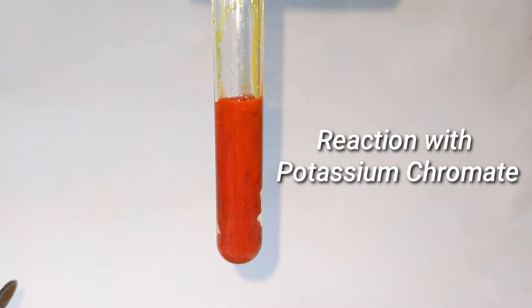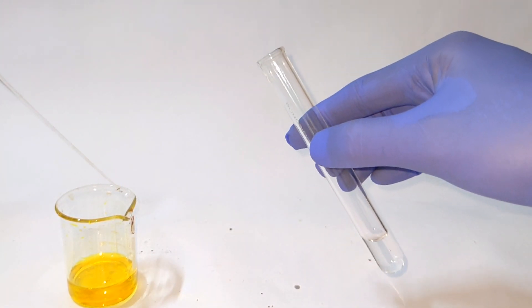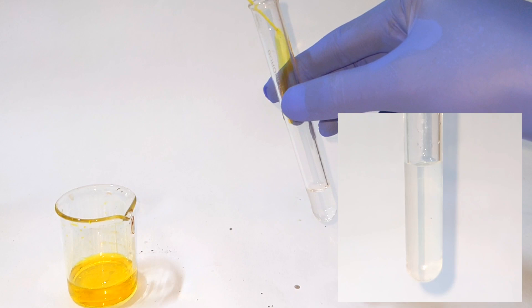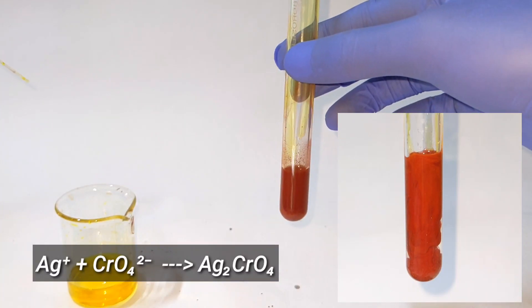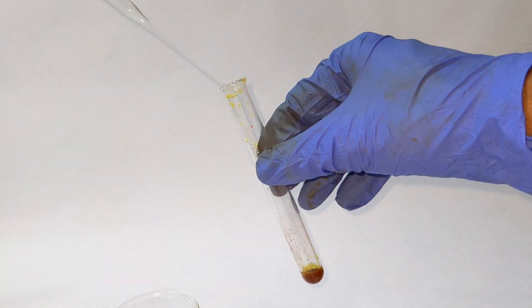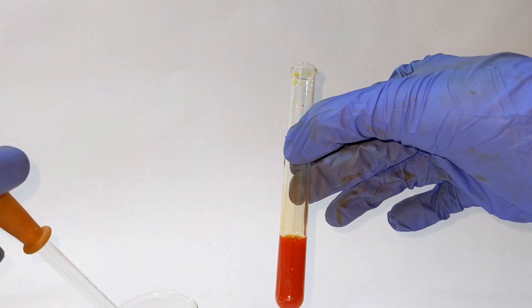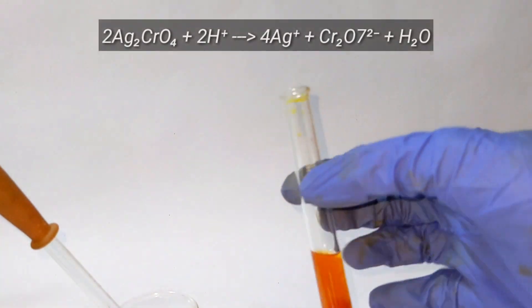Now moving on to the reaction with potassium chromate. We have a yellow-colored solution of potassium chromate and silver nitrate solution in a test tube. On adding the potassium chromate, a bright red colored precipitate of silver chromate is formed. Some of that red precipitate is taken and dilute nitric acid is added; you immediately see the precipitate dissolve and the solution turn orange due to the formation of dichromate.